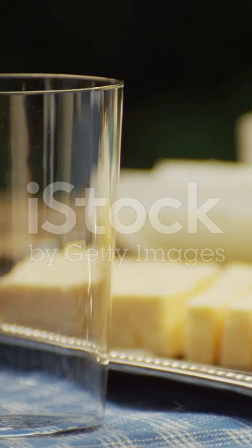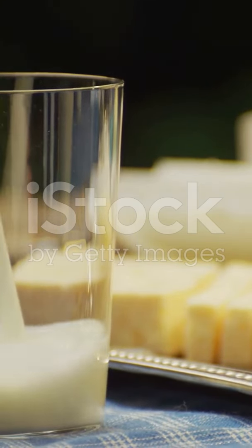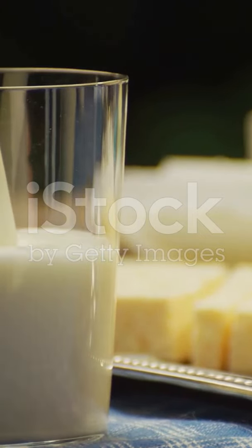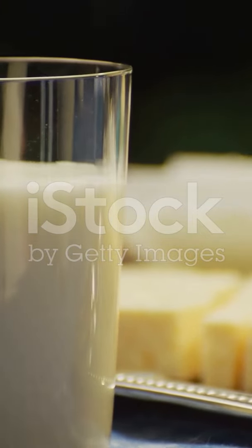Principle: applying high heat denatures the whey proteins, lactoglobulins, and acid then helps coagulate them along with the caseins. This increases yield. Procedure: heat milk to near boiling, 85 to 90 degrees centigrade. Add acid while stirring. The curds will form almost instantly and are more firm.